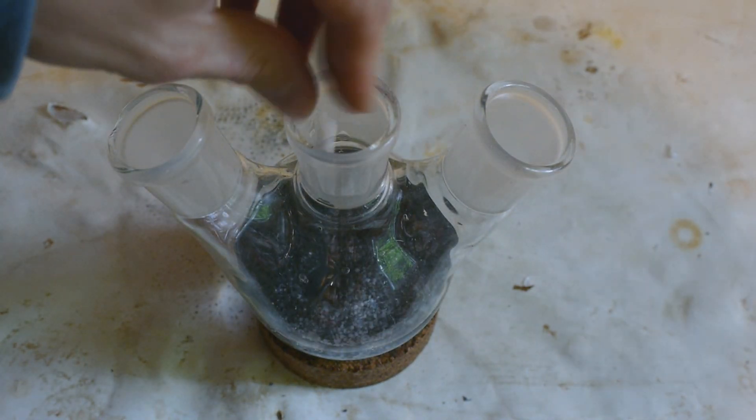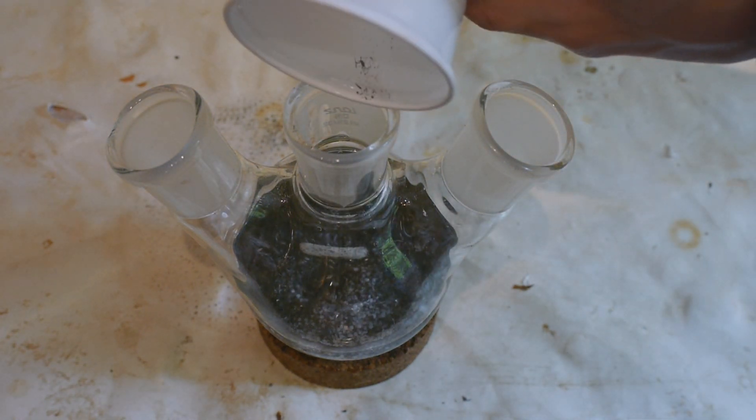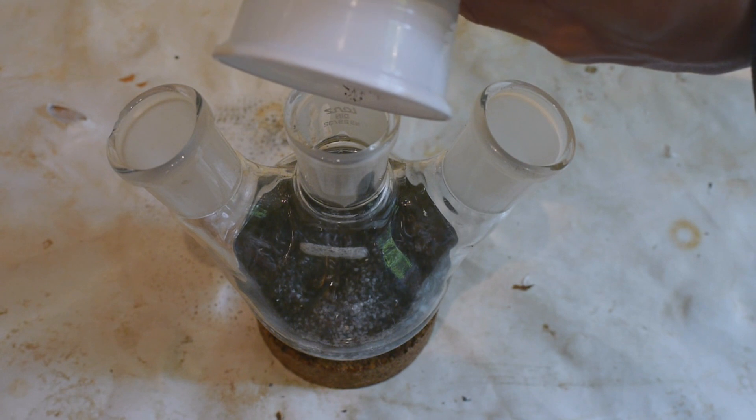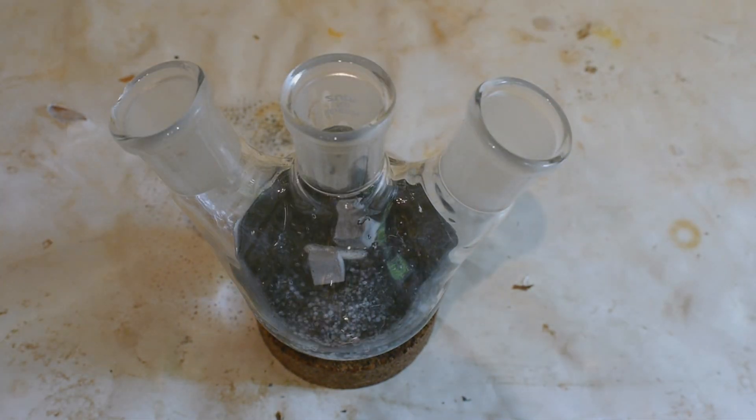Also we shouldn't forget to add a stir bar. And last but not least we need 3 grams of sodium metal to jumpstart the reaction. And now I have to assemble the apparatus.